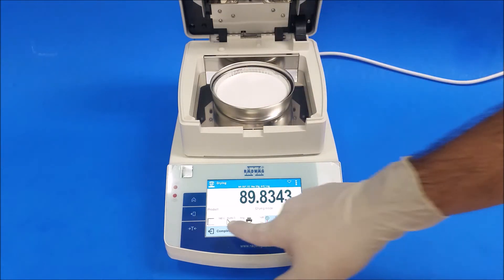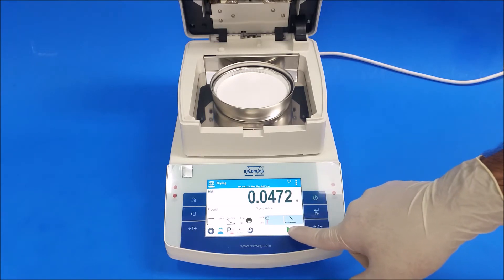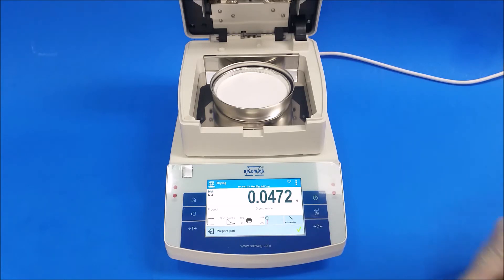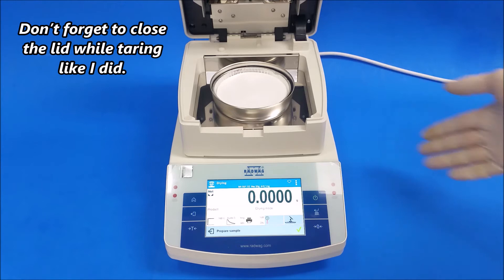Place the new pads in, press the complete button, press the arrow once more, then press the check mark and you're ready to run a new test.